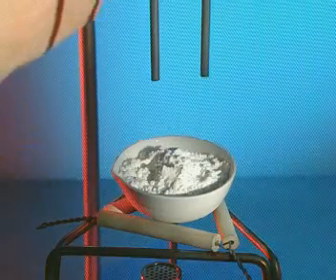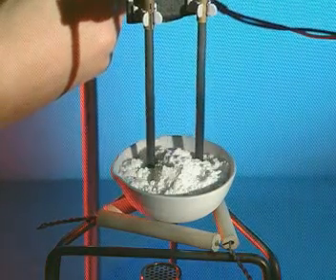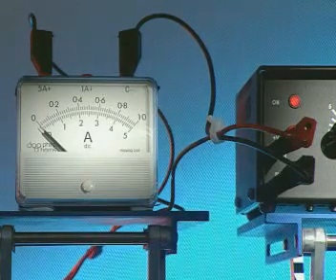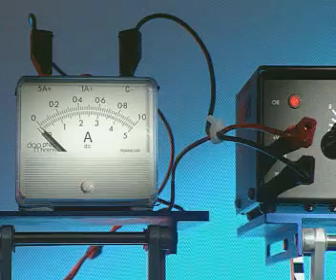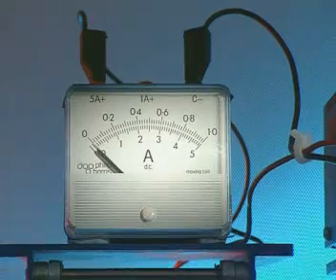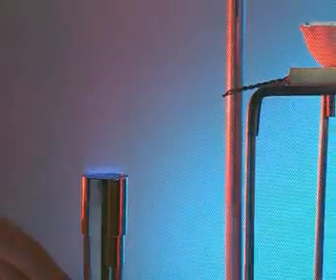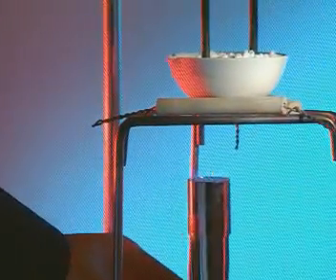The white powder is lead bromide. Switch on the power supply and nothing happens. The ammeter reads zero. Solid lead bromide doesn't conduct electricity. It needs to be molten.